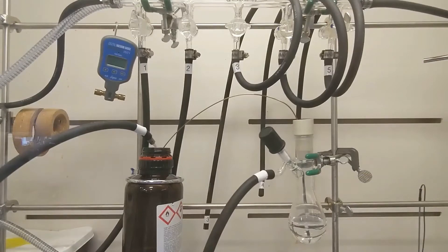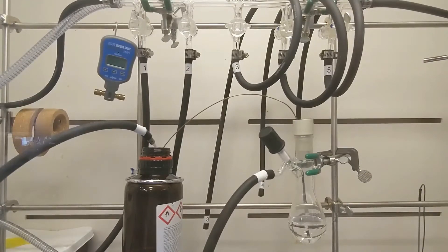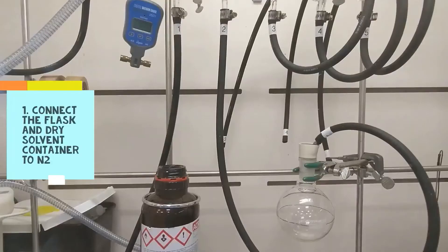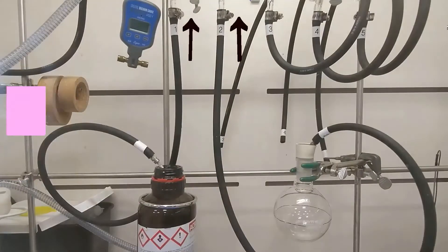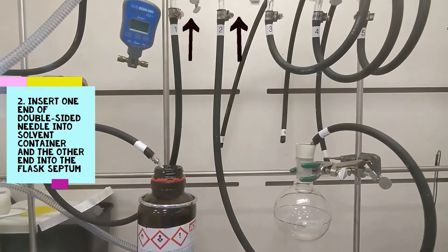And that's all there is to it. You got it? Great! Let's go ahead and see this process again with a round-bottom flask instead of a Schlenk flask. We are going through the same motions but now the tubing is simply connected with a needle through the rubber septum on top.